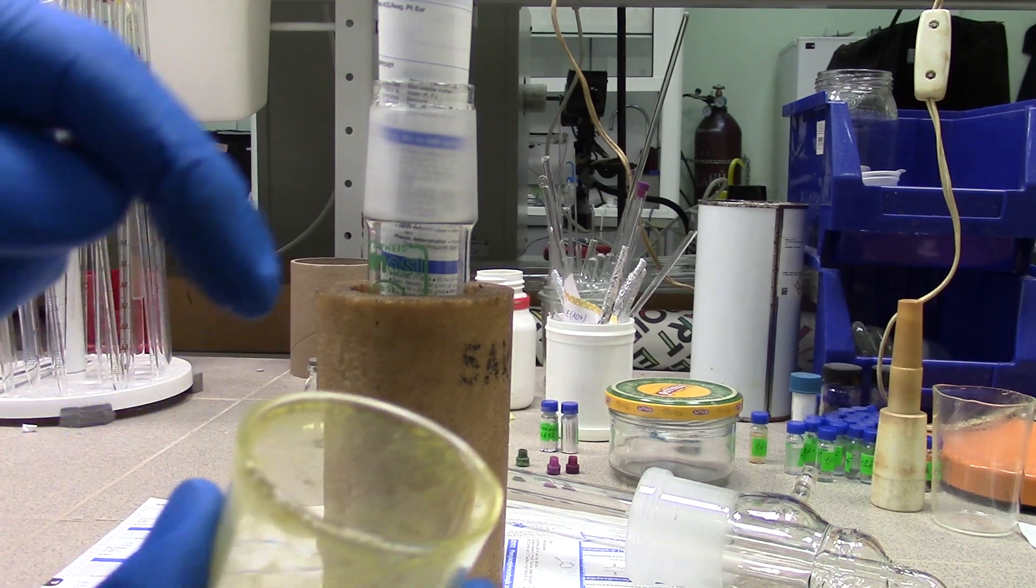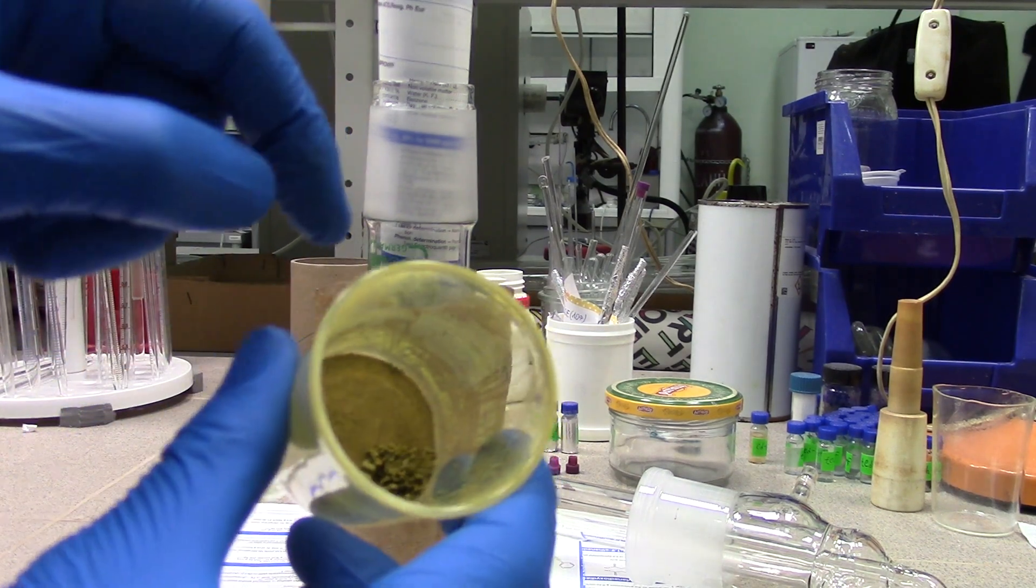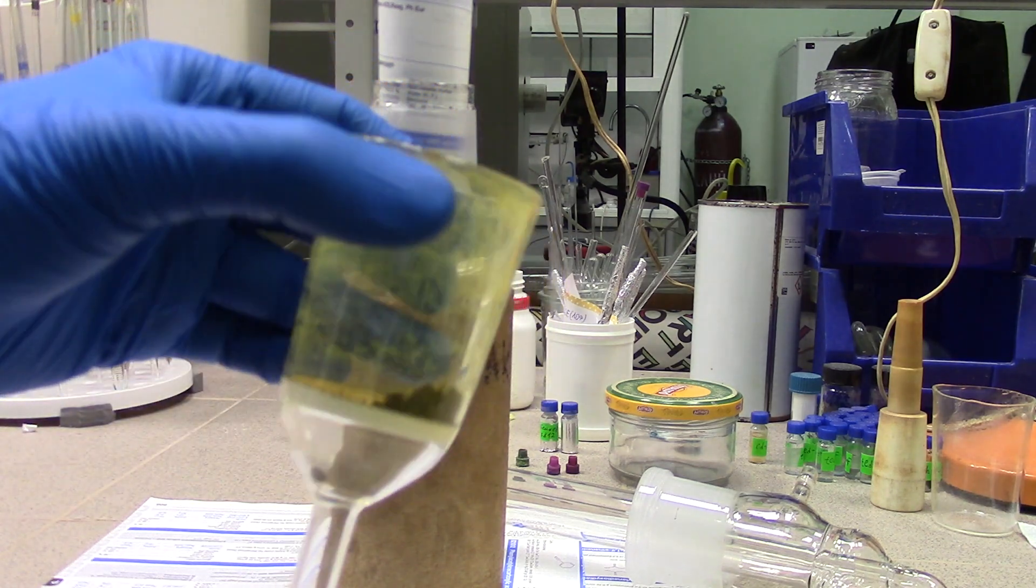For today's experiment I'm going to use a sample of dried slurry after Suzuki Miyaura coupling reaction.